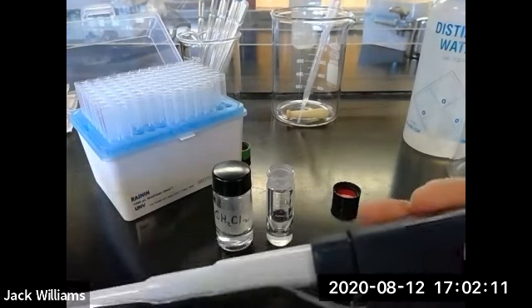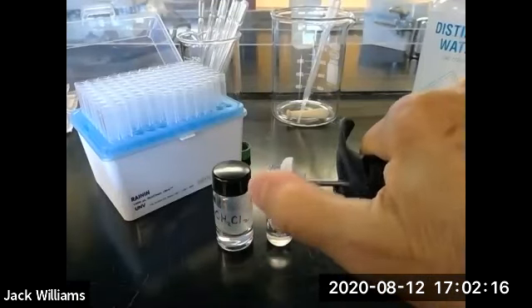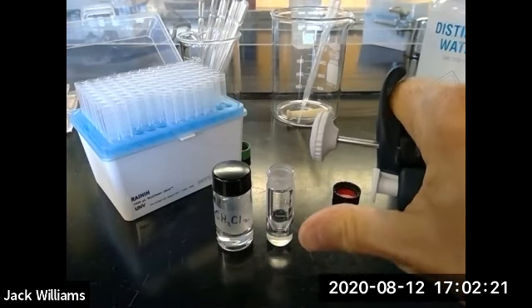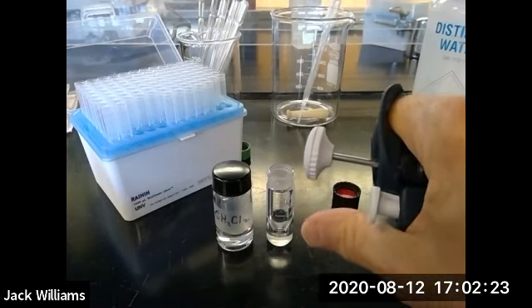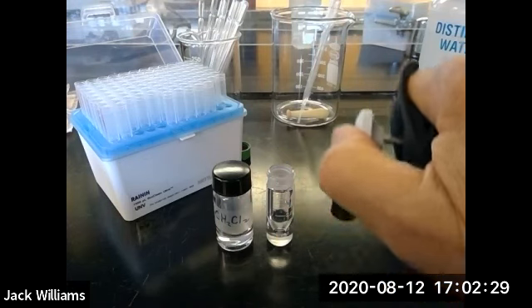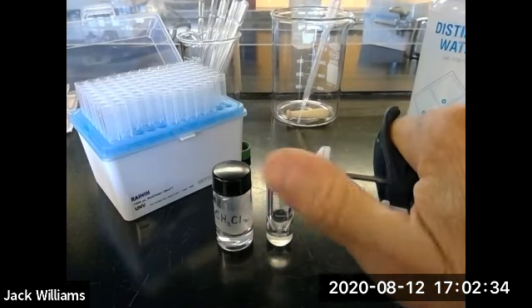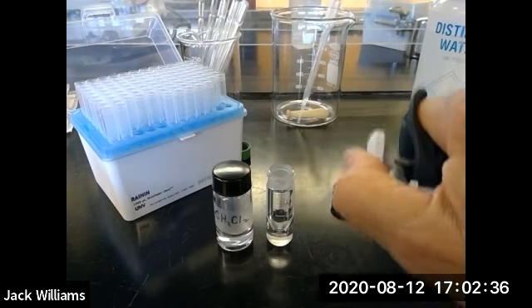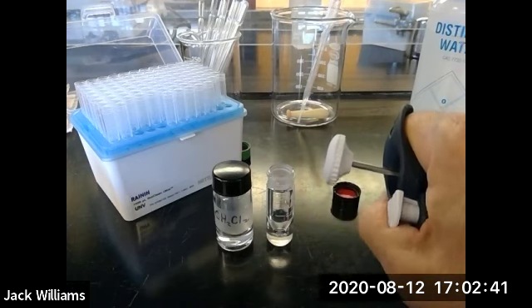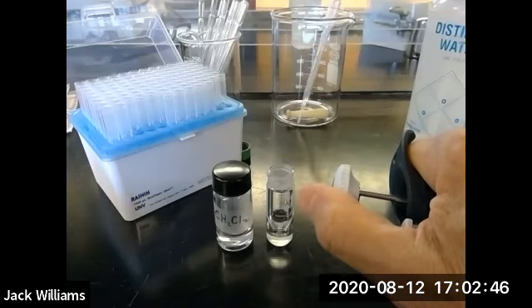Now on the top of the pipette, there's two settings for the plunger. First setting, and second setting. So when you aspirate, that is when you withdraw a liquid into the pipette tip, you go down to the first setting, place the pipette tip into the liquid, and then draw up slowly. So you don't go like this and then like that. That's not gonna work, all right? So just easy does it, and then draw it up.